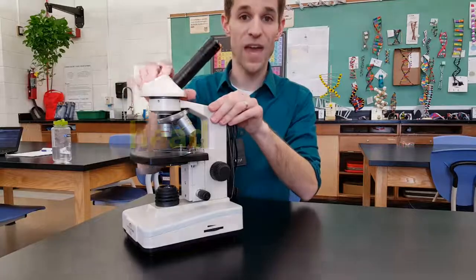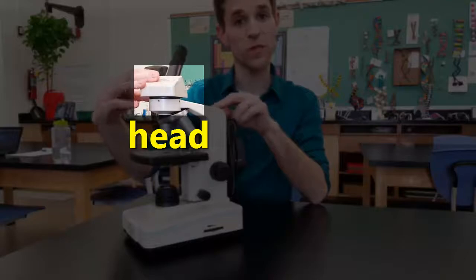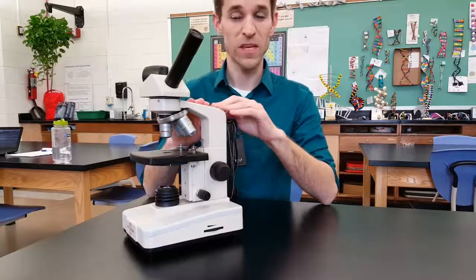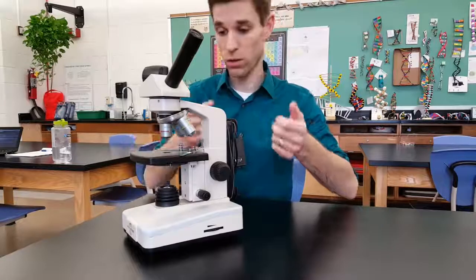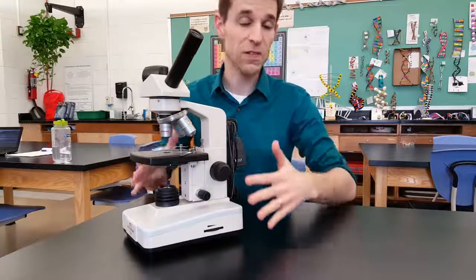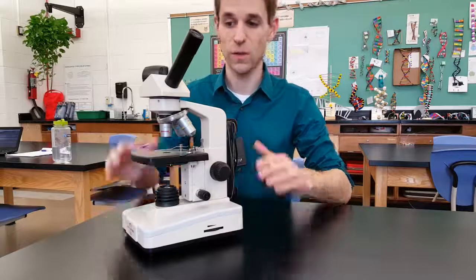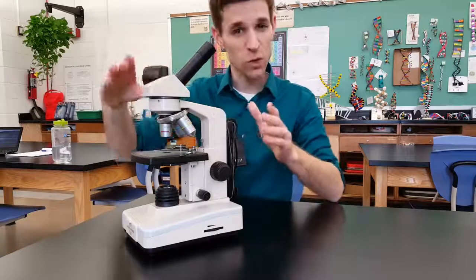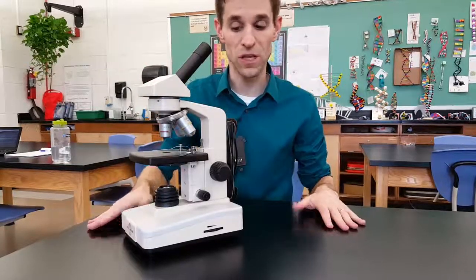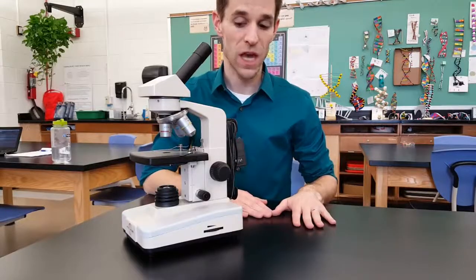The eyepiece is attached to the head. The head on these scopes rotates, so you can ask a friend to look at your specimen and somebody else at your table can look at your specimen without moving the microscope. Because you're looking at things that are microscopic, you don't want to be moving the scope all the time, because your specimen is going to get jostled and vibrate — and if this is a living specimen, you might kill it, for example with single-celled organisms. So you want to make sure you rotate the head. Not all of our scopes do that.